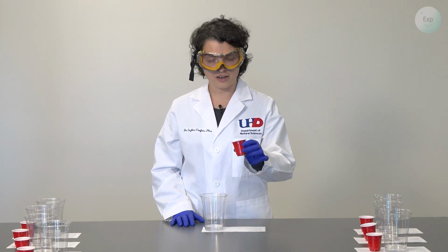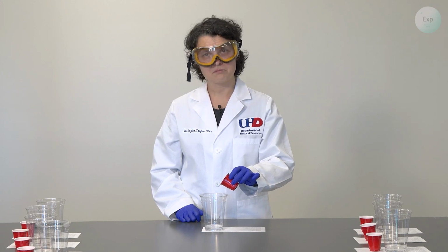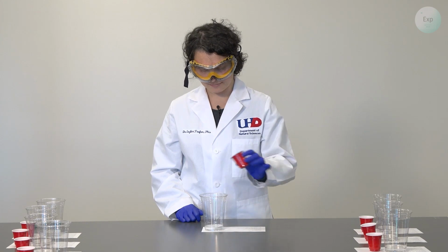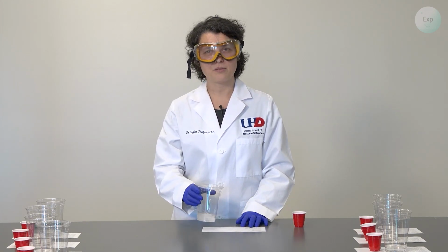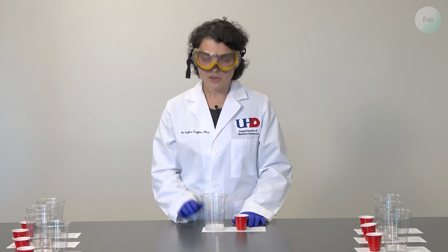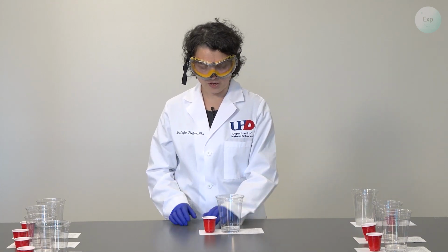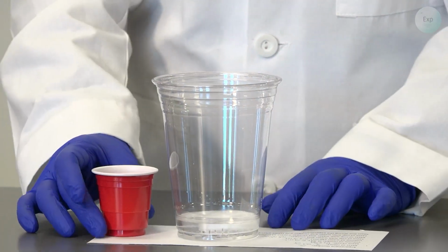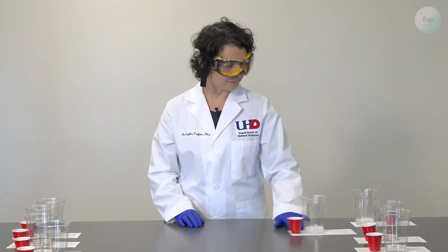We're going to take our Alka-Seltzer tablet from the little cup, and we're going to transfer it by a simple plop into the large cup that contains the water in experiment 1. It goes in, we give it a swirl, and this is the benefit of using a larger cup. It's not going to splash out. We place it on top of it and then slide it back, because very quickly we can move on to experiment 2, which goes the exact same way. The only difference is that in this case, we have a little bit of vinegar in our solution.